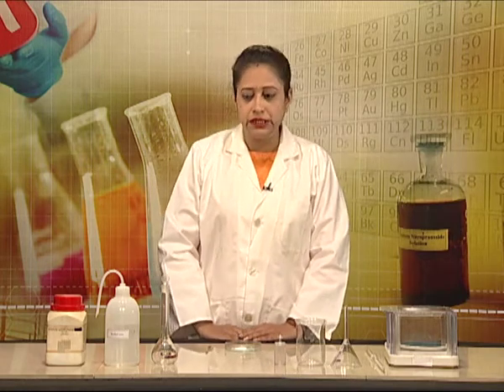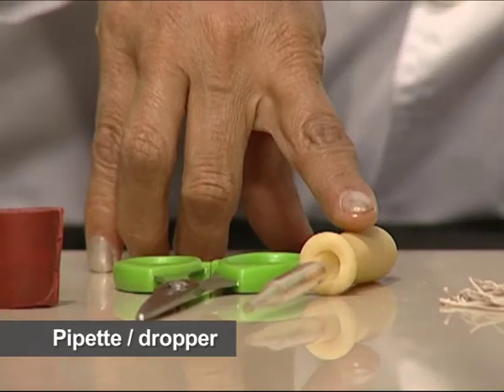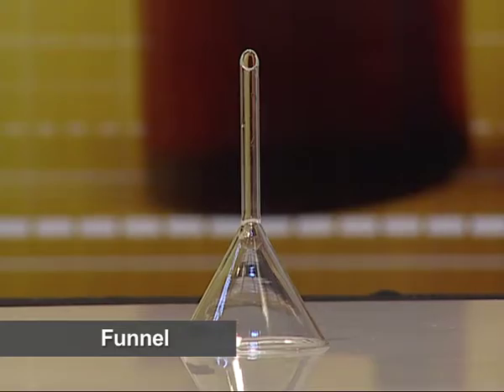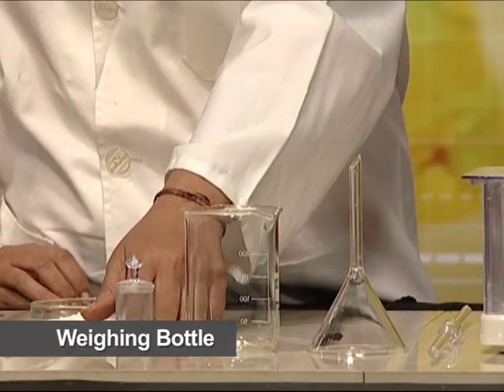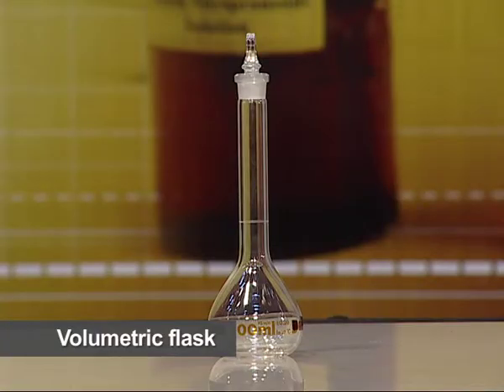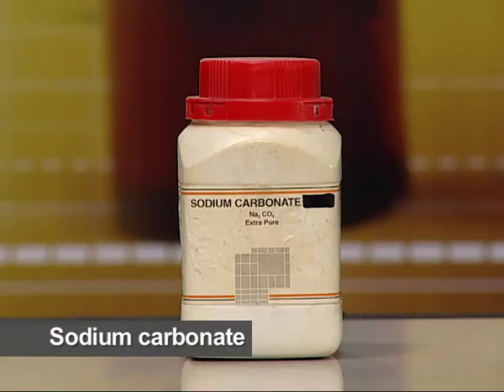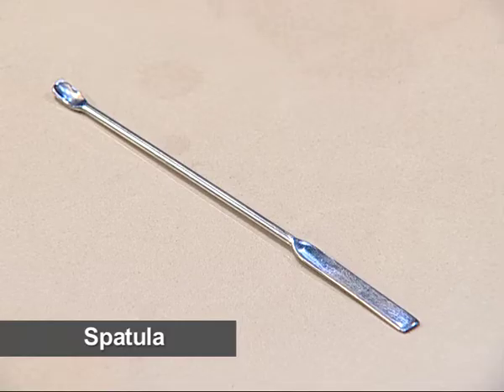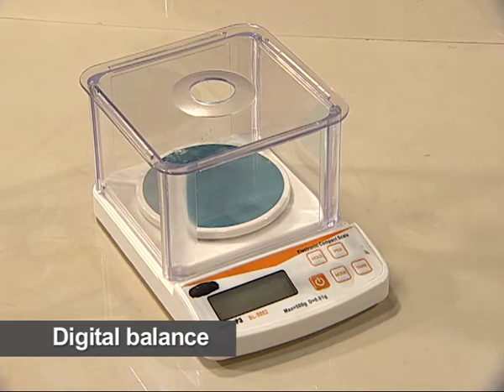We will be needing a pipette or a dropper, a funnel, a beaker, a weighing bottle, a volumetric flask, distilled water, sodium carbonate salt, a spatula, and a digital balance.